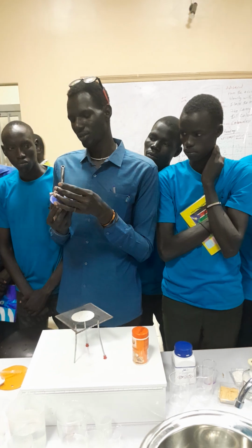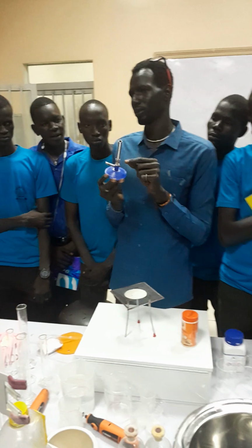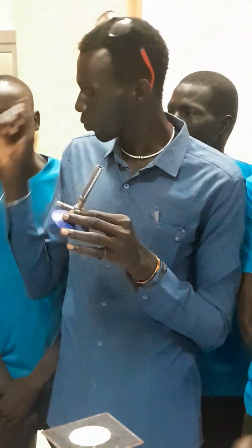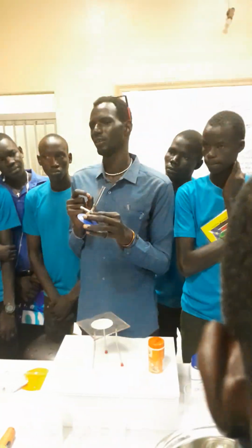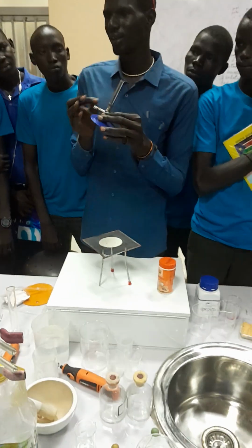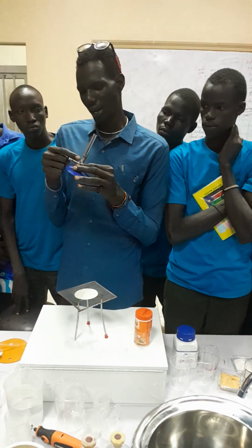And then there is a ring here inside. You see this opening? This opening is called the collar. It is made of metal, a metallic ring. If you look at it, it is like a ring. The function of the collar is to regulate, and the term regulate means to control, the amount of air entering during opening or closing. When you are opening it, the amount of air entering is controlled by the collar. And if you close it, the amount of air is also controlled by what? By the collar.